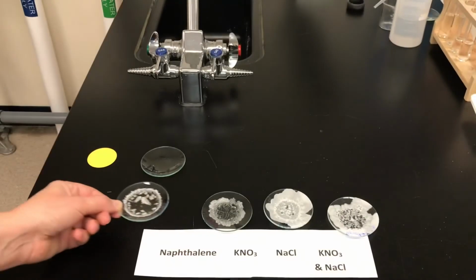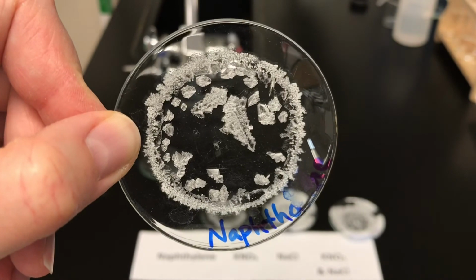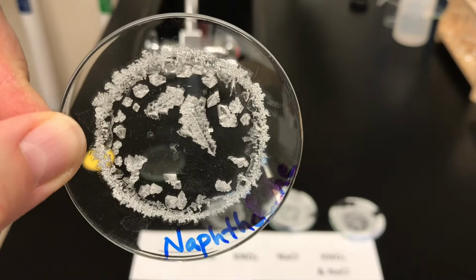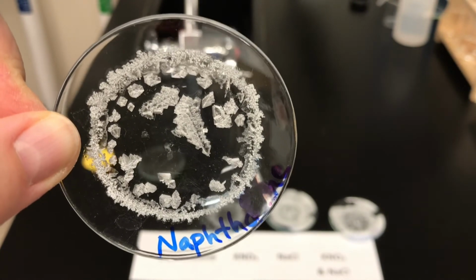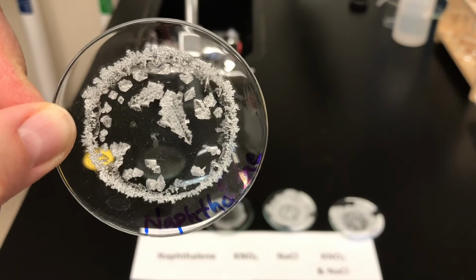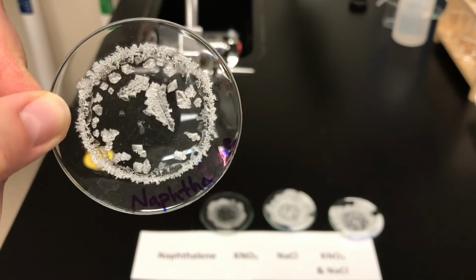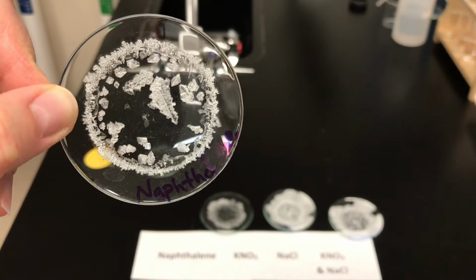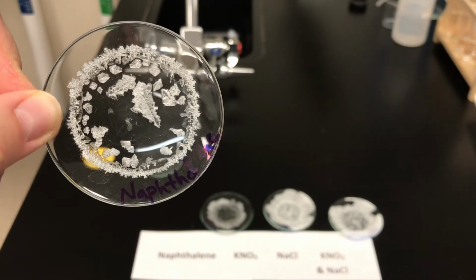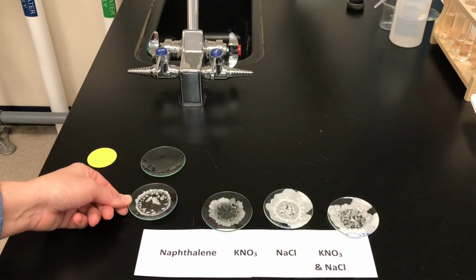So the naphthalene crystal, maybe you can just put that back there for one second, Ms. Watts. It's hard to describe their crystal shape in a simple way. When you get some really nice crystals of naphthalene, sometimes they have a bit of a leafy look to them, like the branches of a leaf. But otherwise, they often just take a random shape that is hard to characterize, other than a white crystalline solid. They don't really have an easily described shape compared to the other ones that we're about to see.